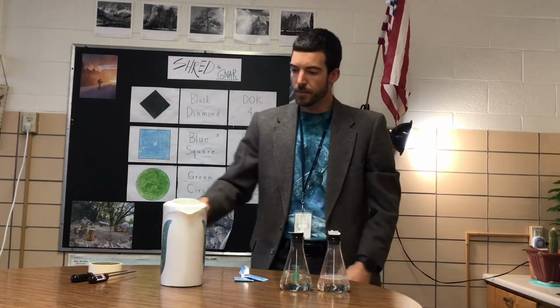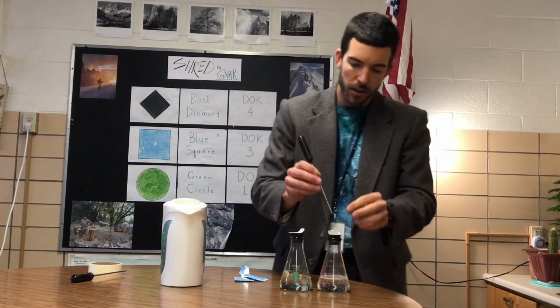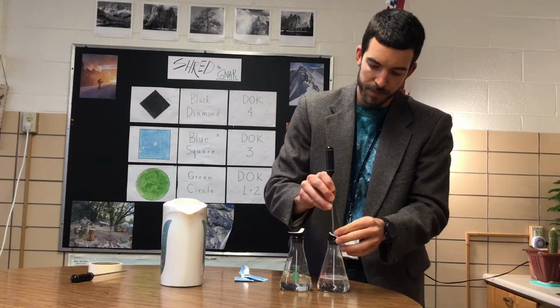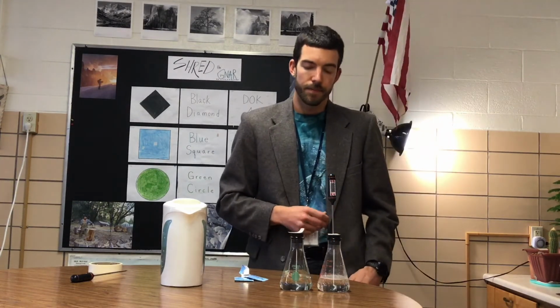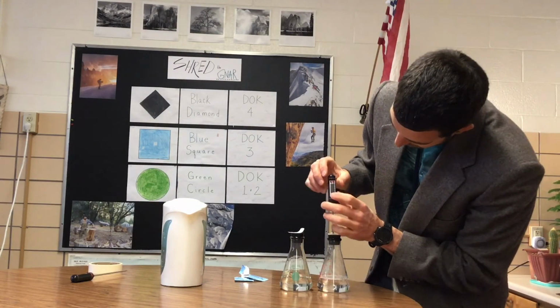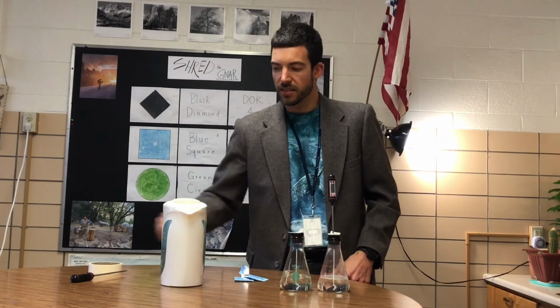So when it comes time to take the temperature, you're going to use these handy dandy thermometers, and you're going to poke it through the hole that's here on the top of our stopper. You're going to place it into the beaker so that it enters the air, not the water. You're going to turn it on, and you're going to take your reading. You should do this probably every about 2 minutes to see how the temperature changes over the class period time that you're in science class.